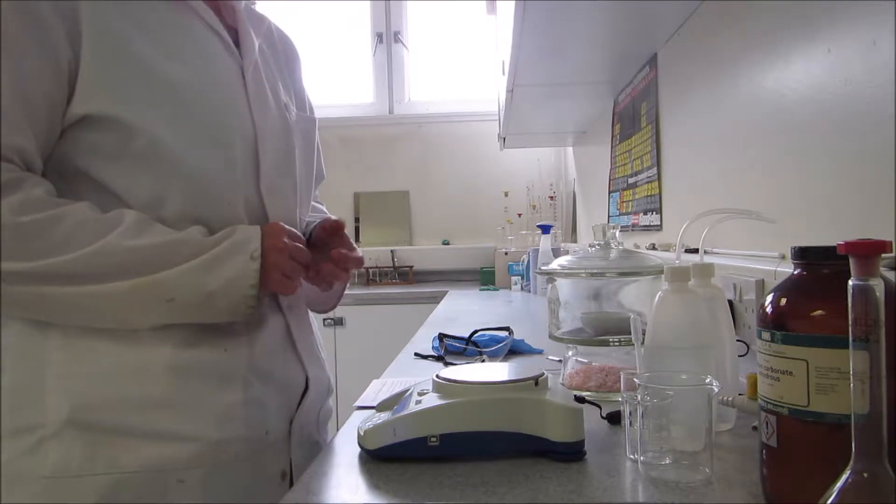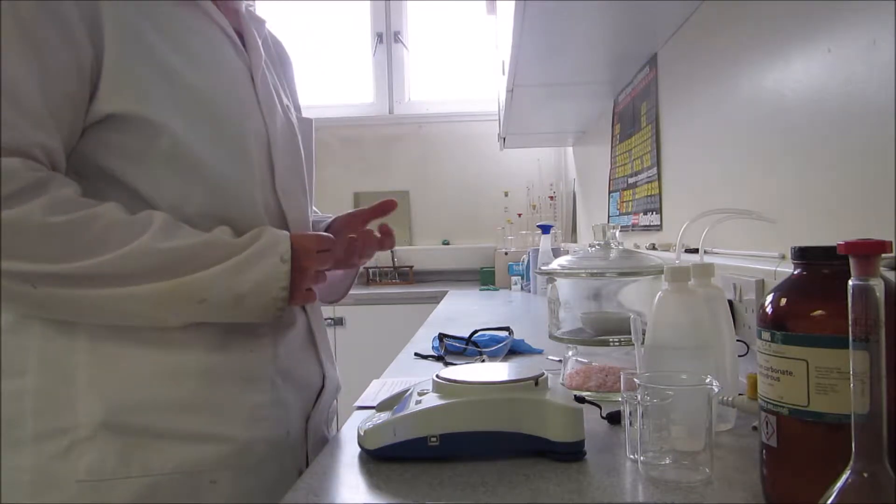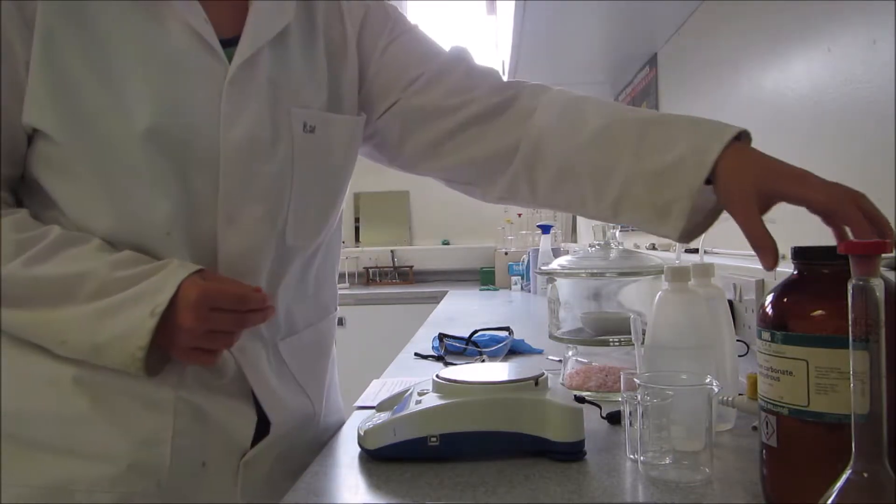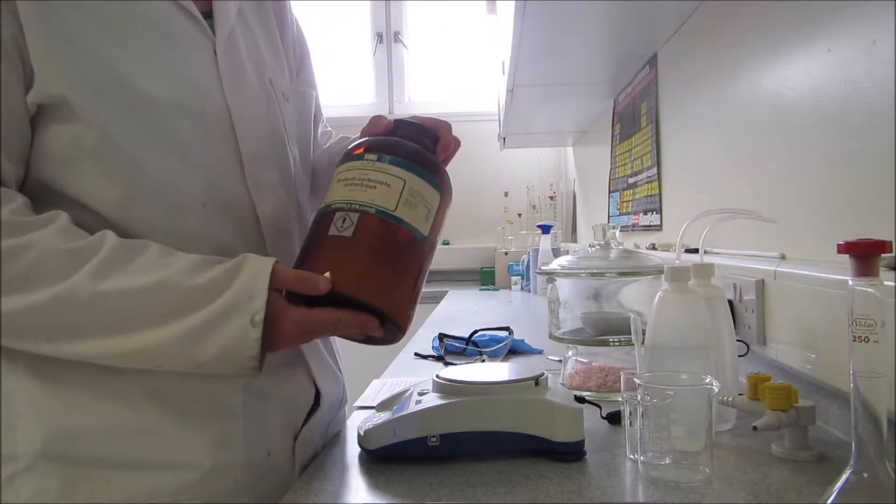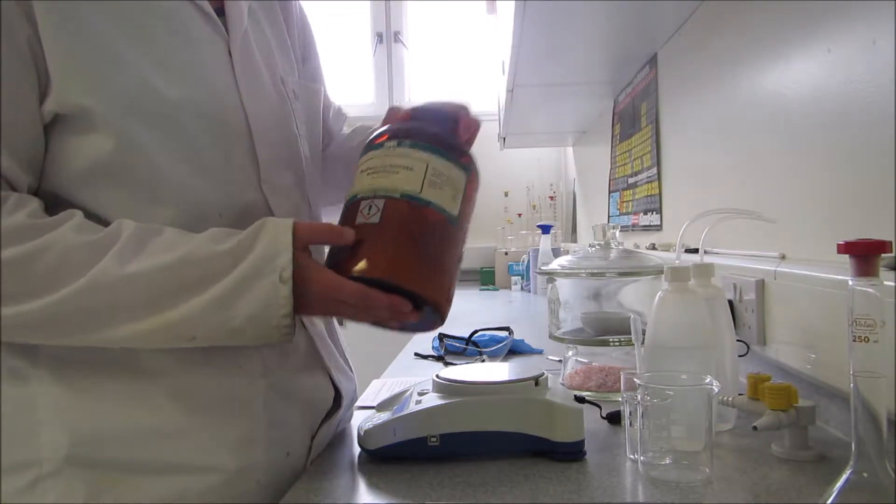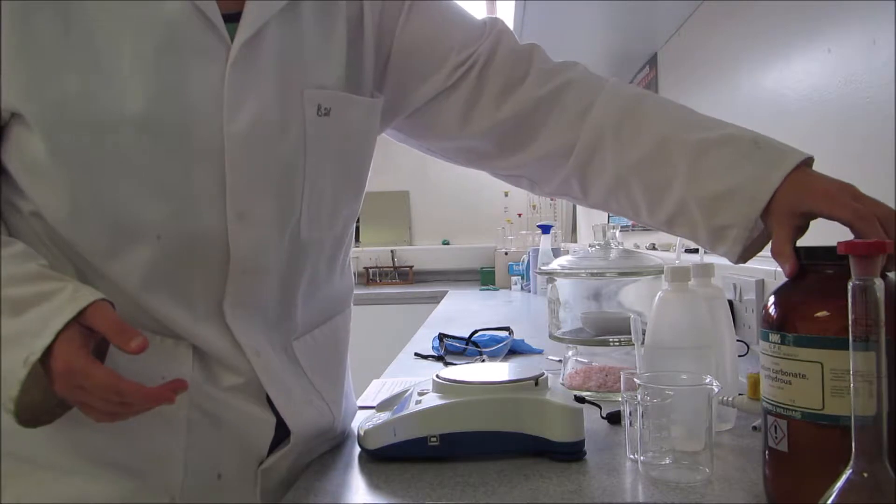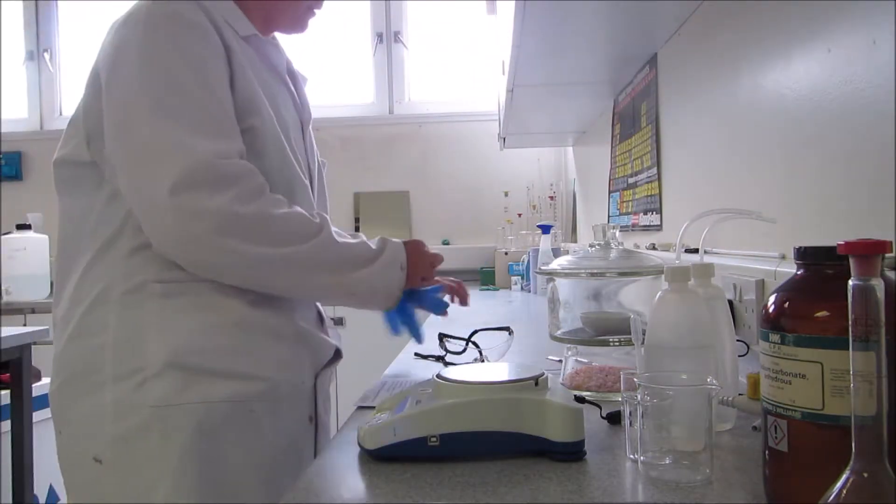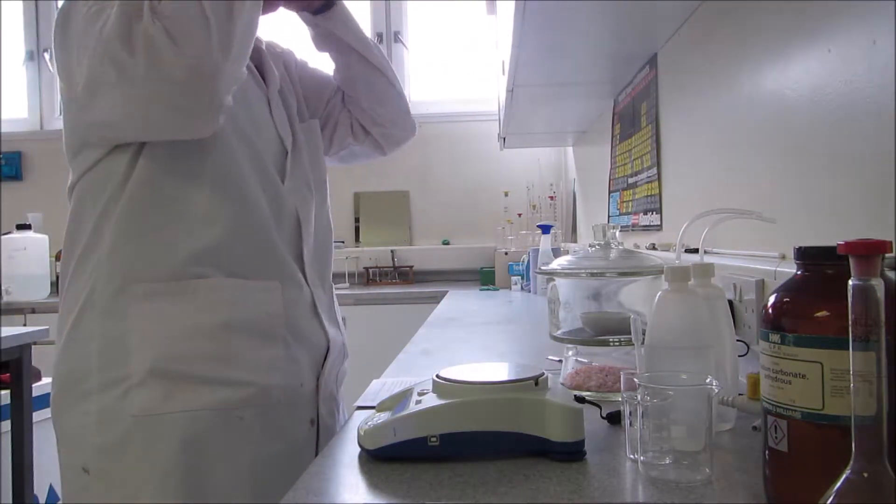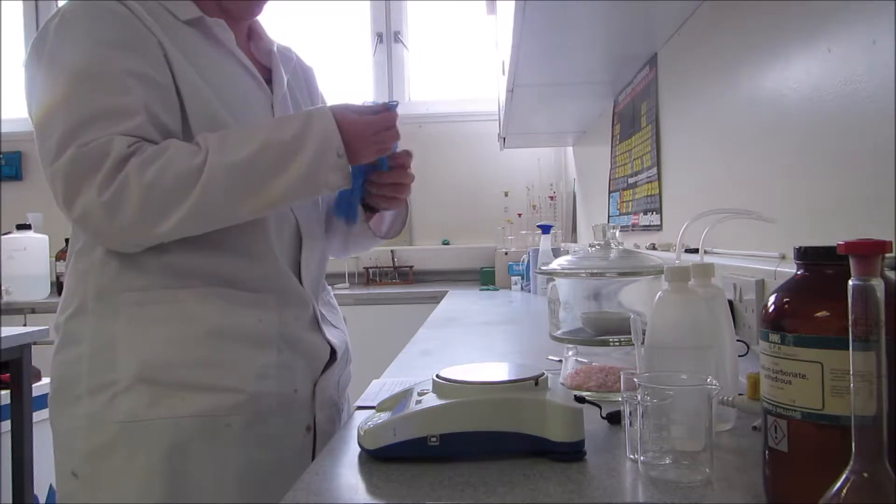In chemistry you're often asked to make up a standard solution, so today I'm going to show you how to make up a standard solution of sodium carbonate anhydrous. As you can see from the warning it's irritant to the eyes, so before I start I'm just going to put on a pair of safety goggles and also a pair of gloves just for general good practice.